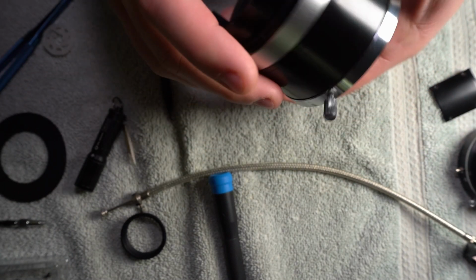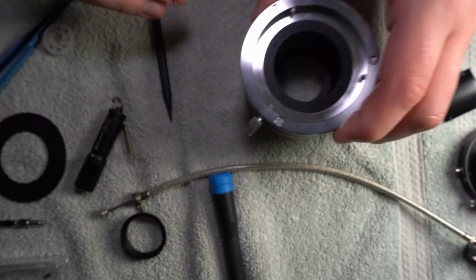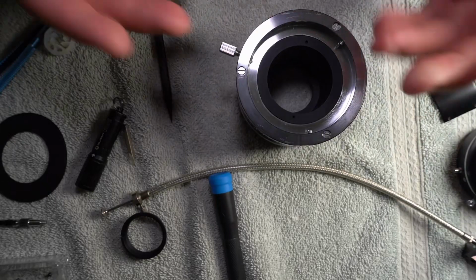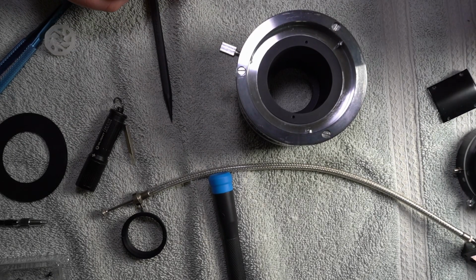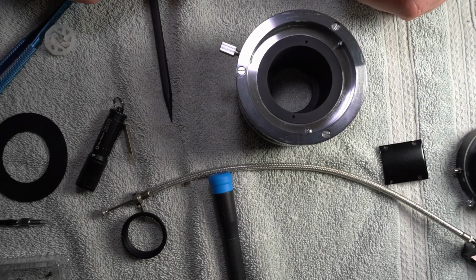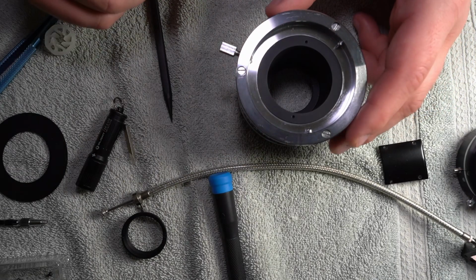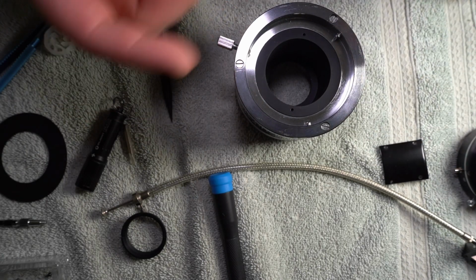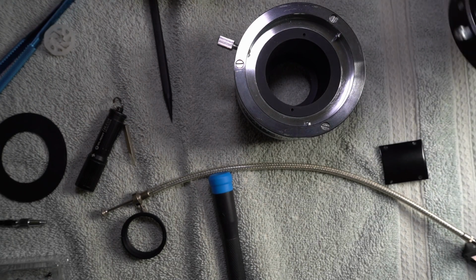It doesn't really need to be torqued, but I kind of want it to have some force behind it. I mean, I'm not really torquing it or anything. If I had the tool, I wouldn't even torque it. But I want it to be set there so that when I use it, it's not rattling around.